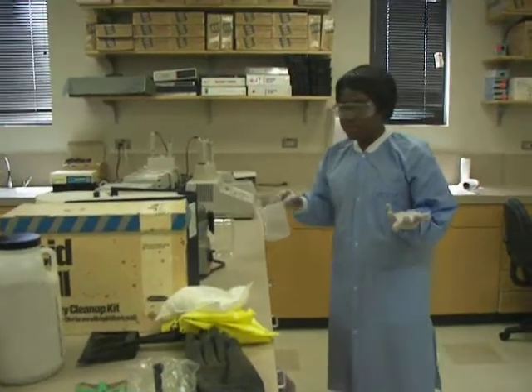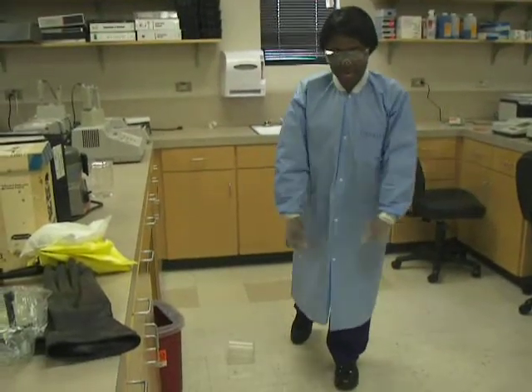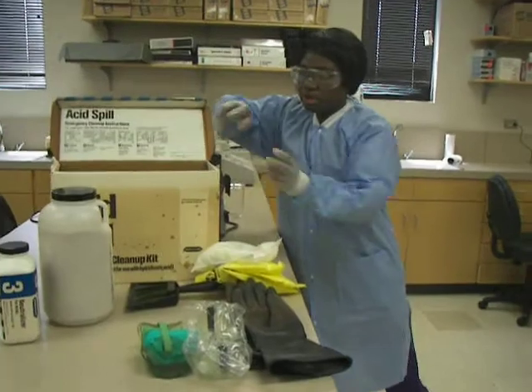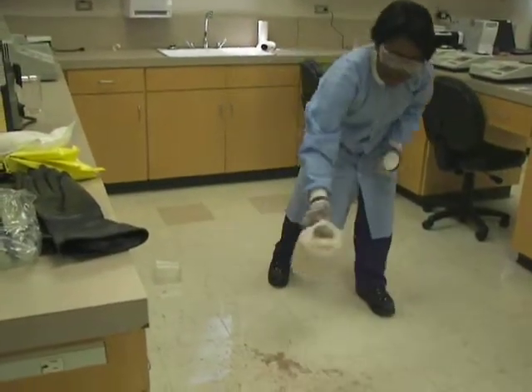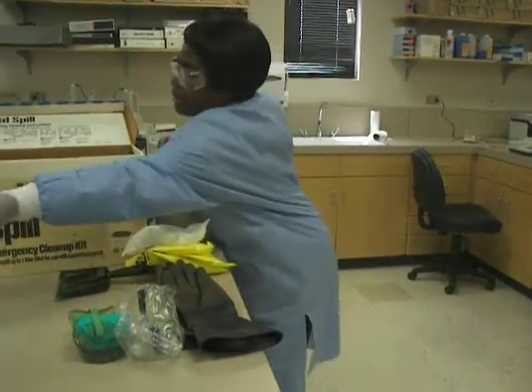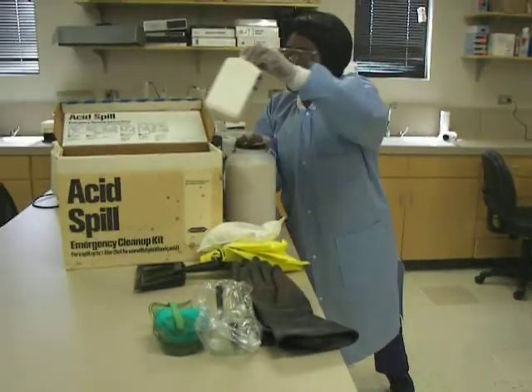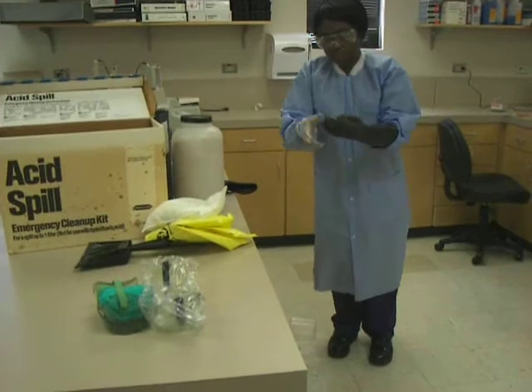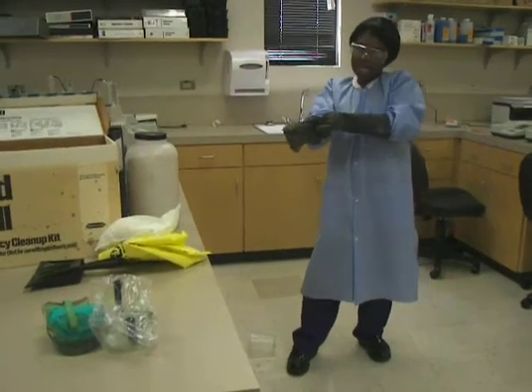If the spill involved is an acid, try to confine and contain that area. Alert the people around you, and create a dam around that chemical. Then get your absorbent and pour it around that area. Next, apply your neutralizer — the neutralizer will neutralize the acid. Then put on your gloves to protect your skin from the corrosive nature of the acid.